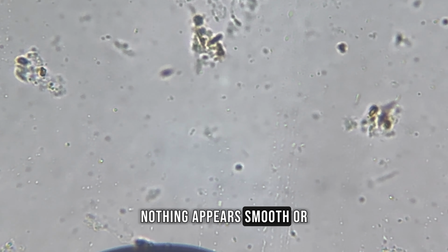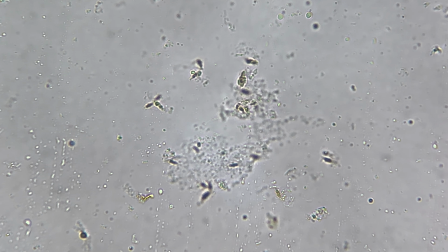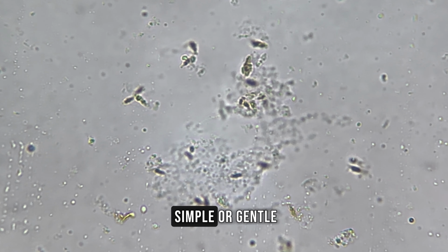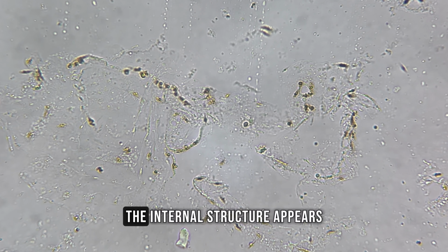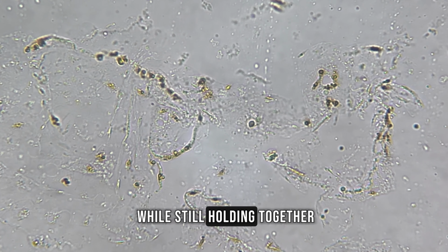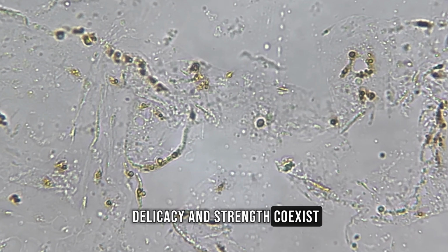Nothing appears smooth or uniform anymore. Every section contains variation in texture and density. At this magnification, the mandarin no longer feels simple or gentle. It begins to look engineered by nature to store liquid efficiently. The internal structure appears designed to break easily while still holding together. This level reveals how delicacy and strength coexist inside the fruit.